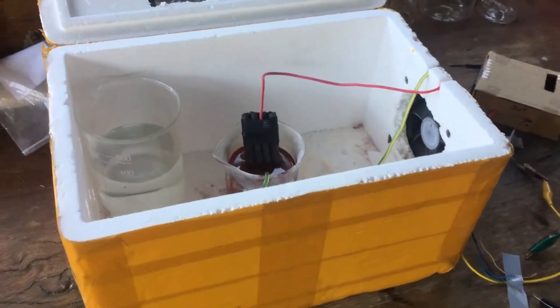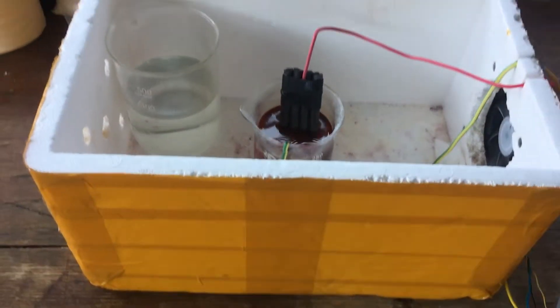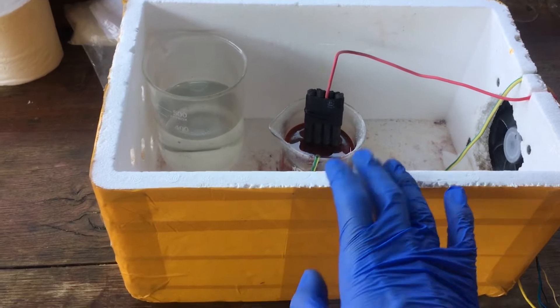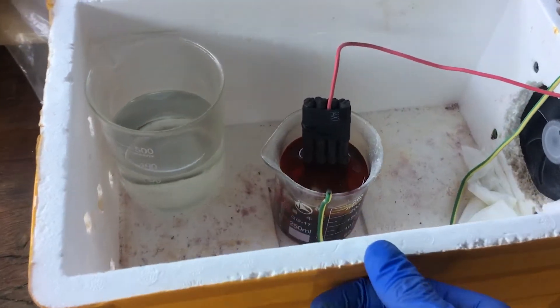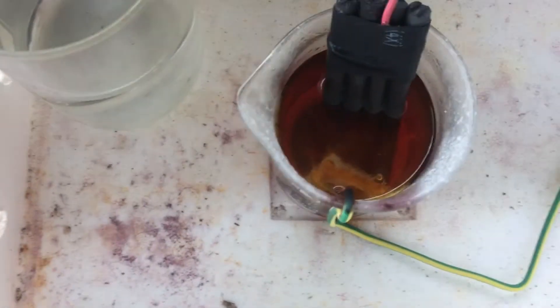Yep, now that I've increased the current to about 1.9 amps, I think we'll just let this go for the rest of the afternoon, and then hopefully later today we'll have a quantity of bromine that we can be proud of making.